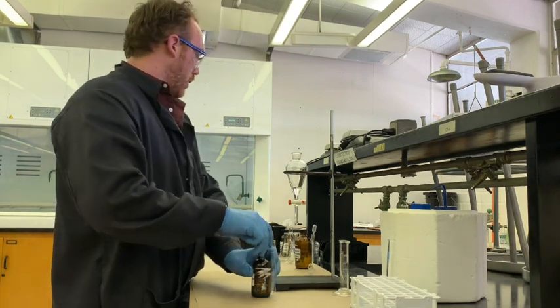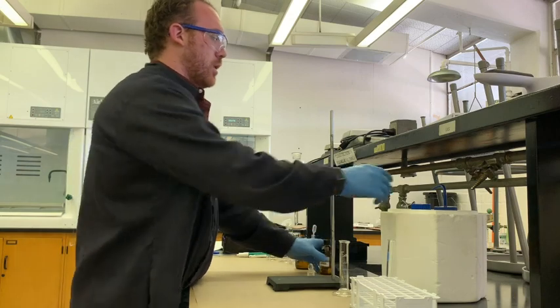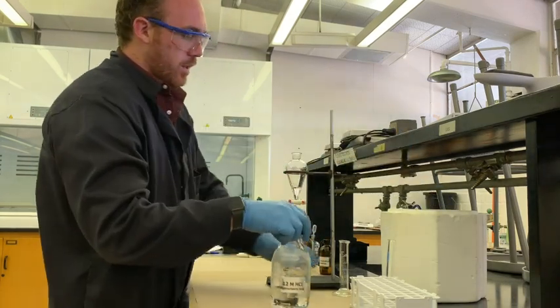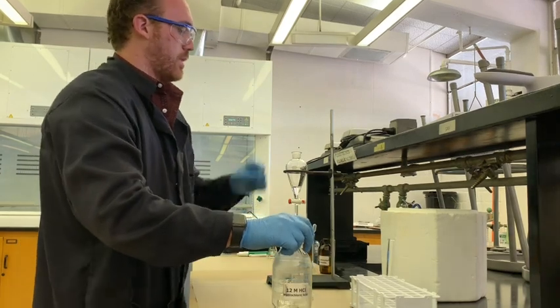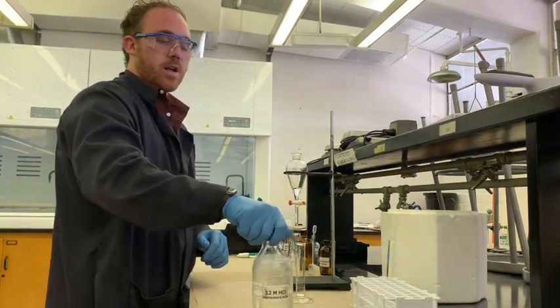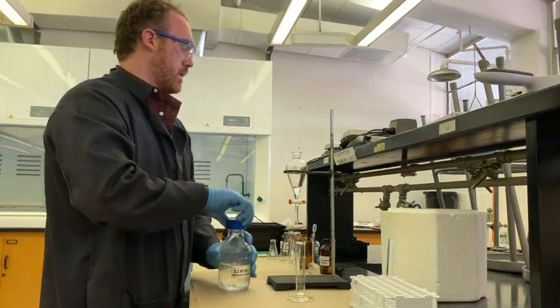Next what we're going to do is we're going to take some of this chilled hydrochloric acid and add 25 milliliters into this flask. That's quite a bit of hydrochloric acid. This is 12 molar. It's very concentrated so you want to be really careful when doing this.